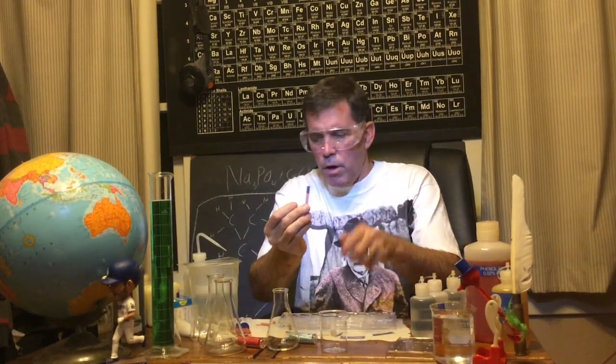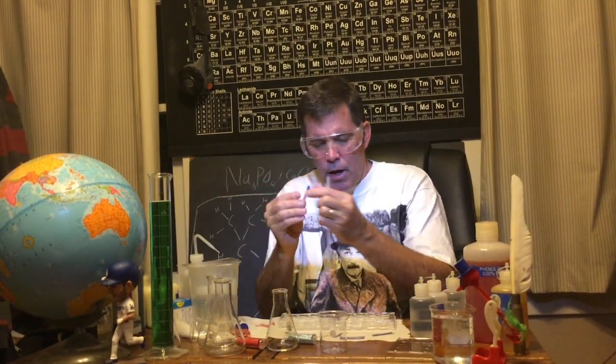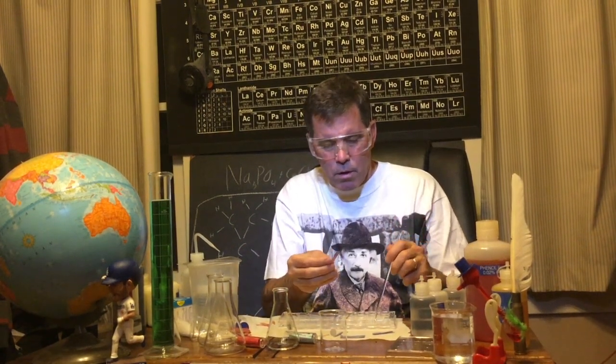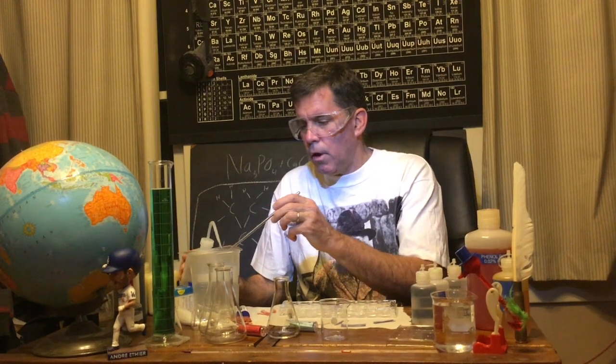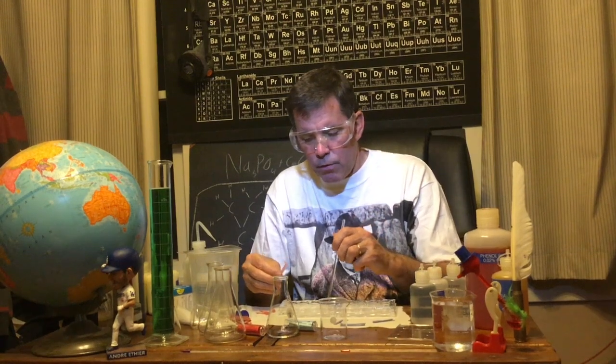See? And if I wanted to, I can take my acid and make it go back to the red again. See that? It's back to the red. So litmus is a certain color in acid, and a different color in base. So let's try the weak base. There you go. See?